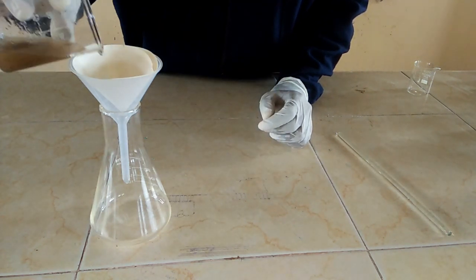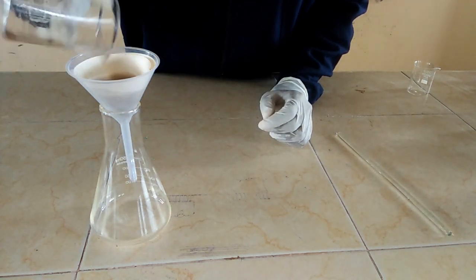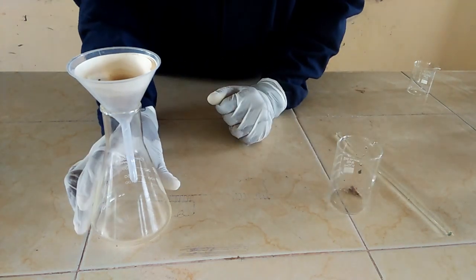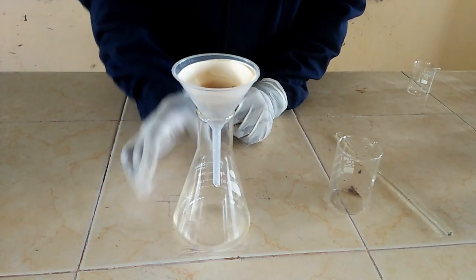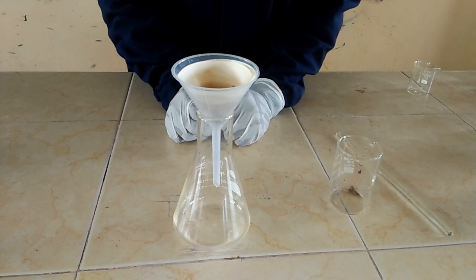Then transfer the mixture onto the filter paper and allow it to filter. Give it some time to allow it to filter.